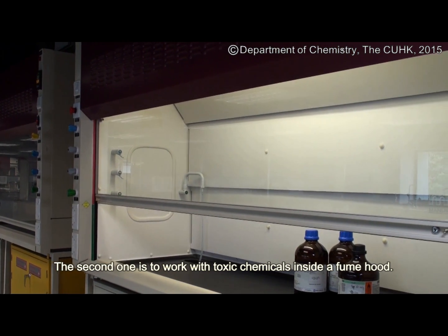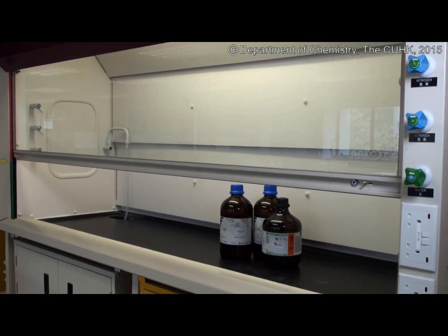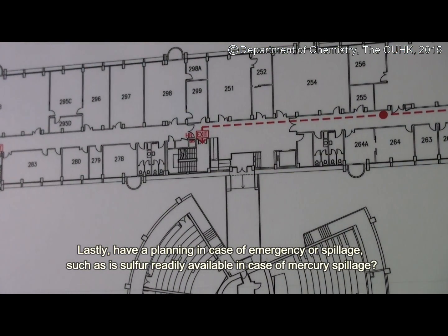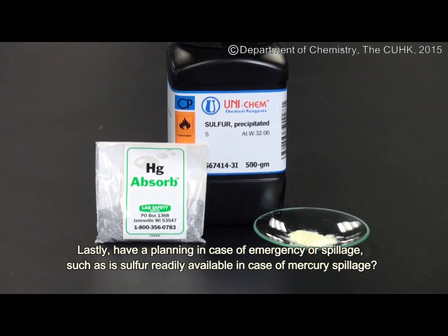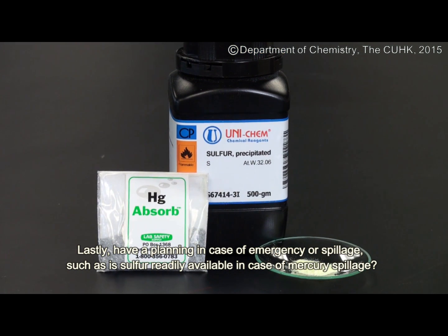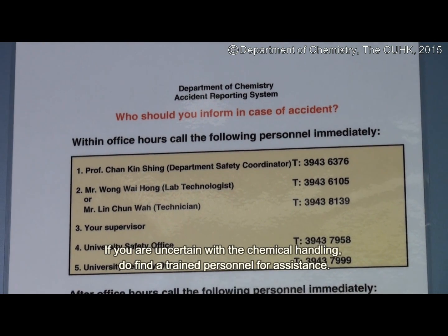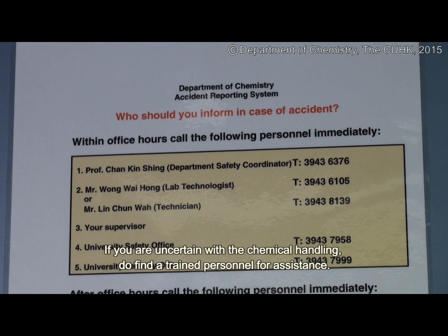The second tip is to work with toxic chemicals inside a fume hood. Lastly, have a plan in case of emergency or spillage — for example, is sulfur powder readily available in case of mercury spillage? If you are uncertain about chemical handling, do find a trained personnel for assistance.